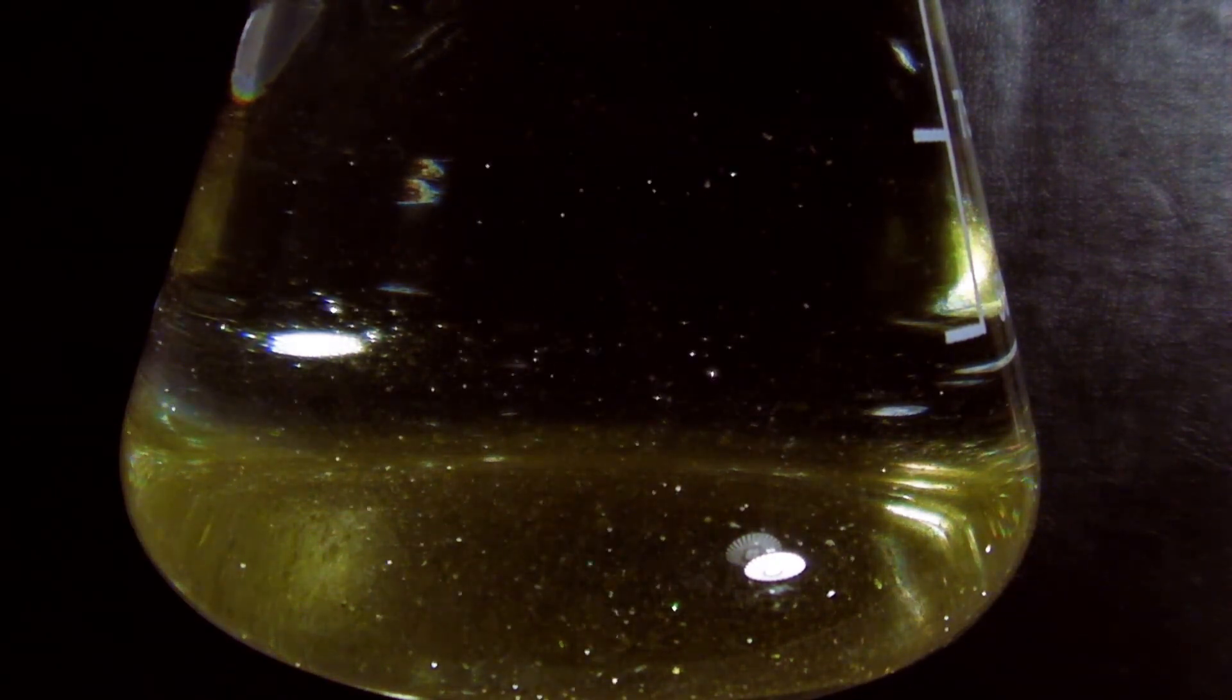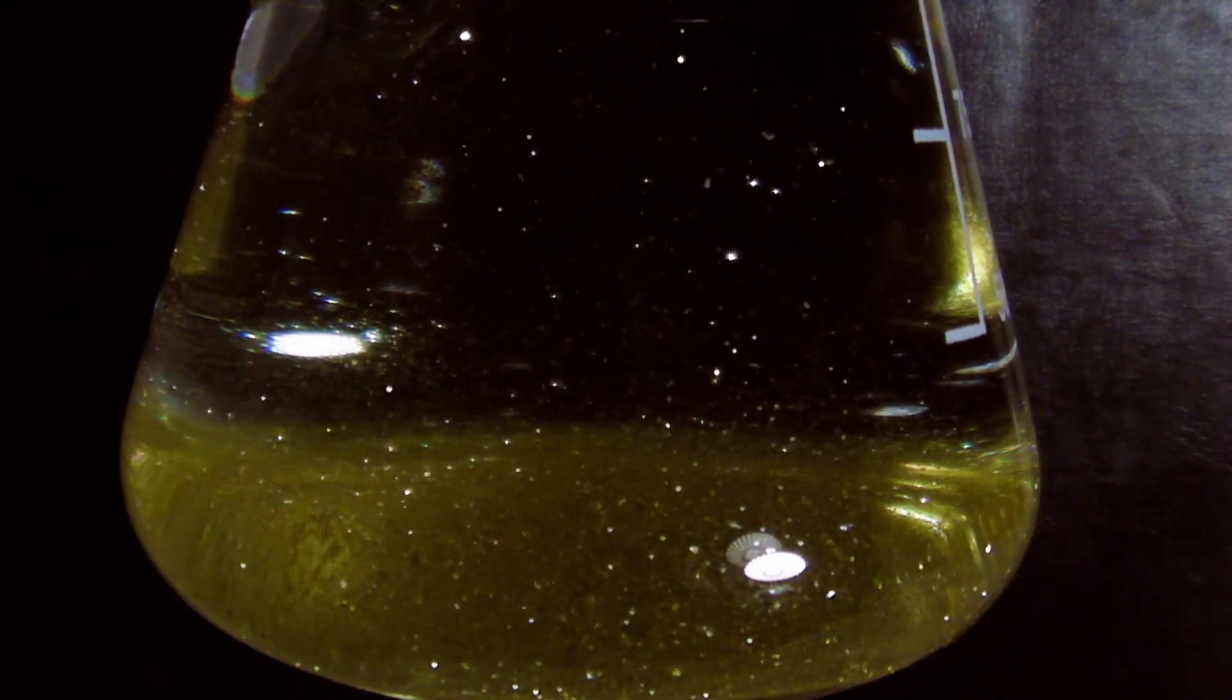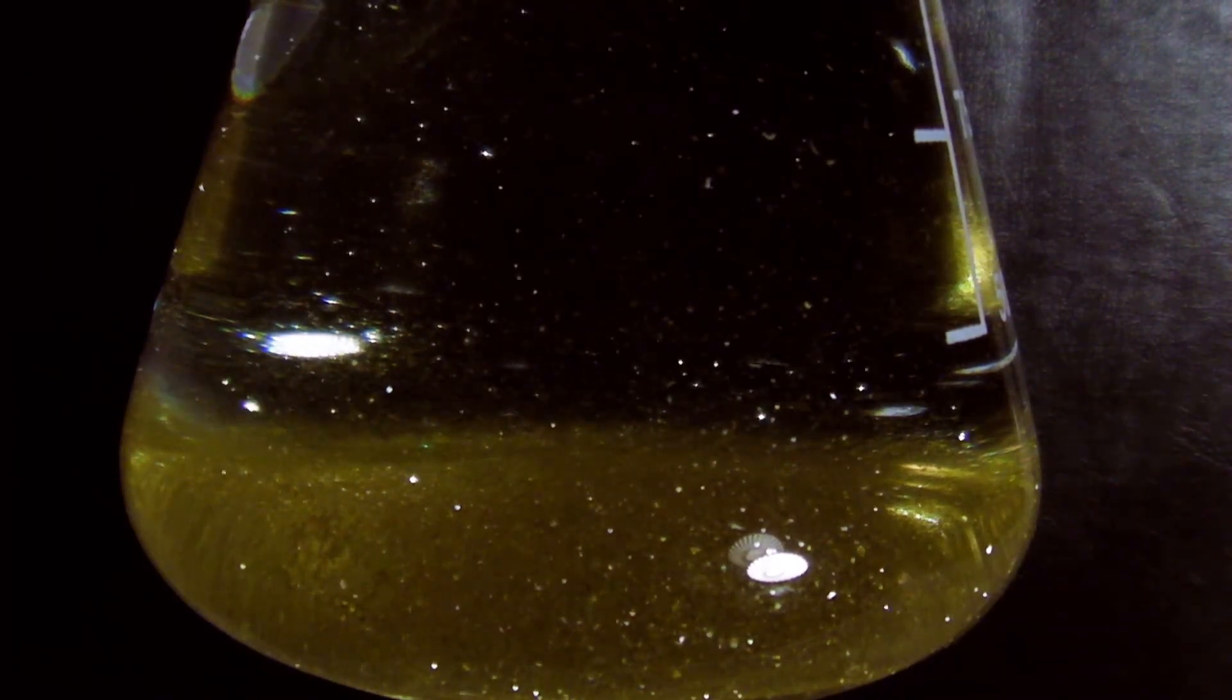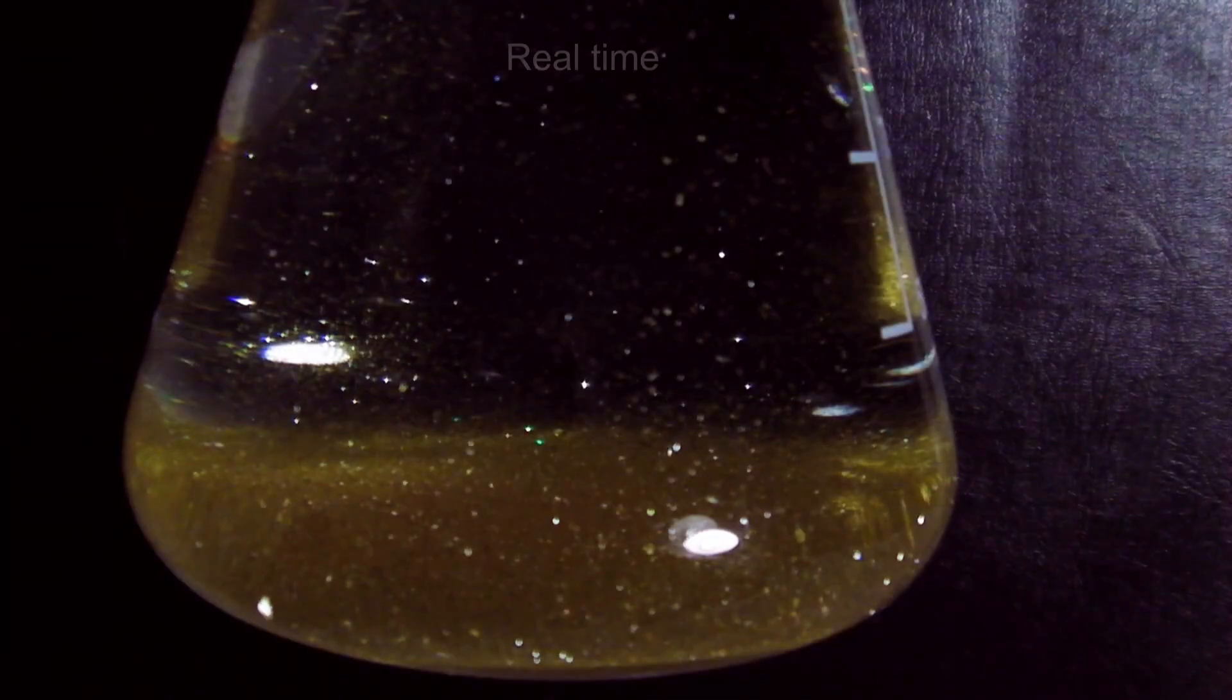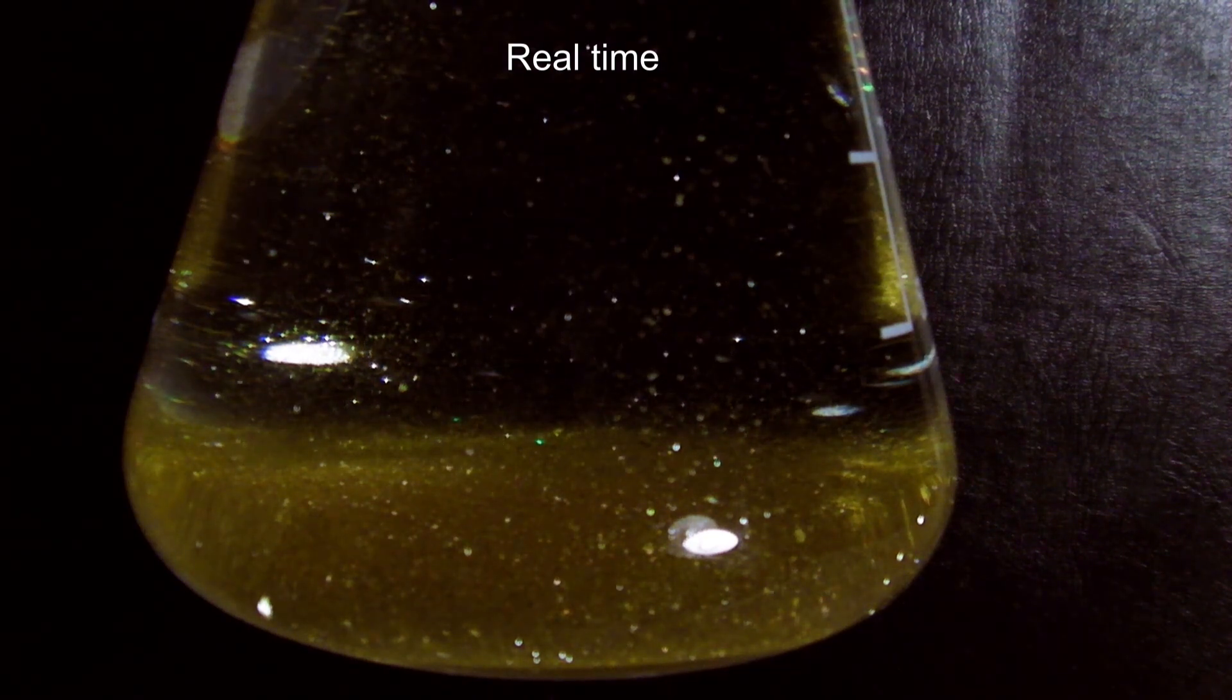Gradually, more crystals are formed and the crystals become larger. A larger batch takes more time to cool down, so larger crystals are obtained.